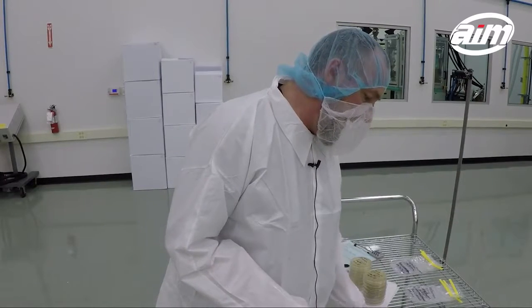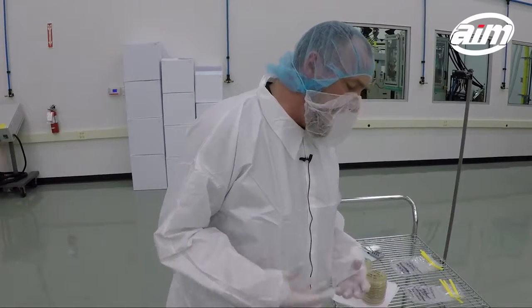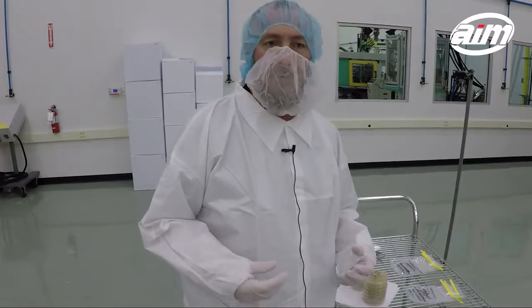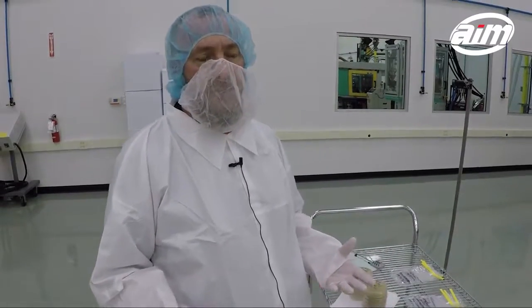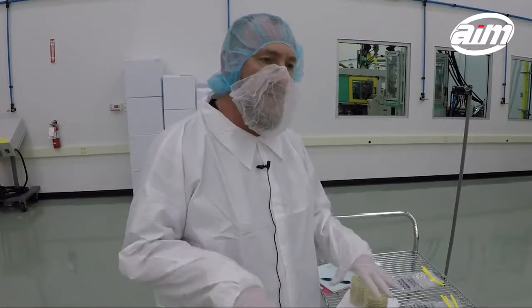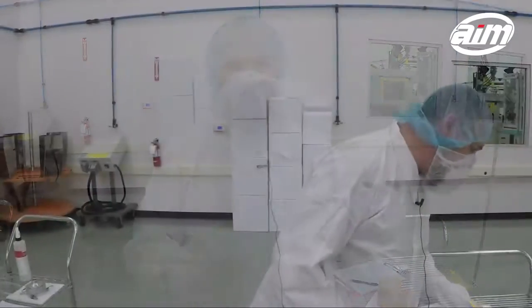For the viable air sampling that we're doing, we're doing eight locations in the clean room, including six in the main clean room, one in the gowning room, and one in the transfer room.